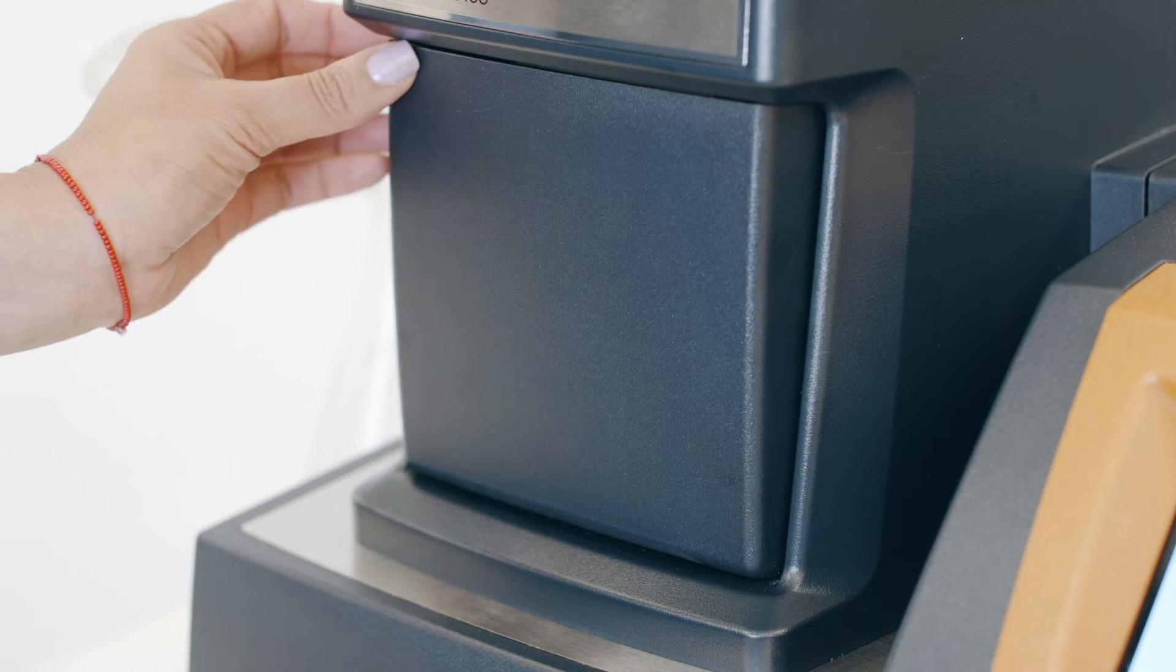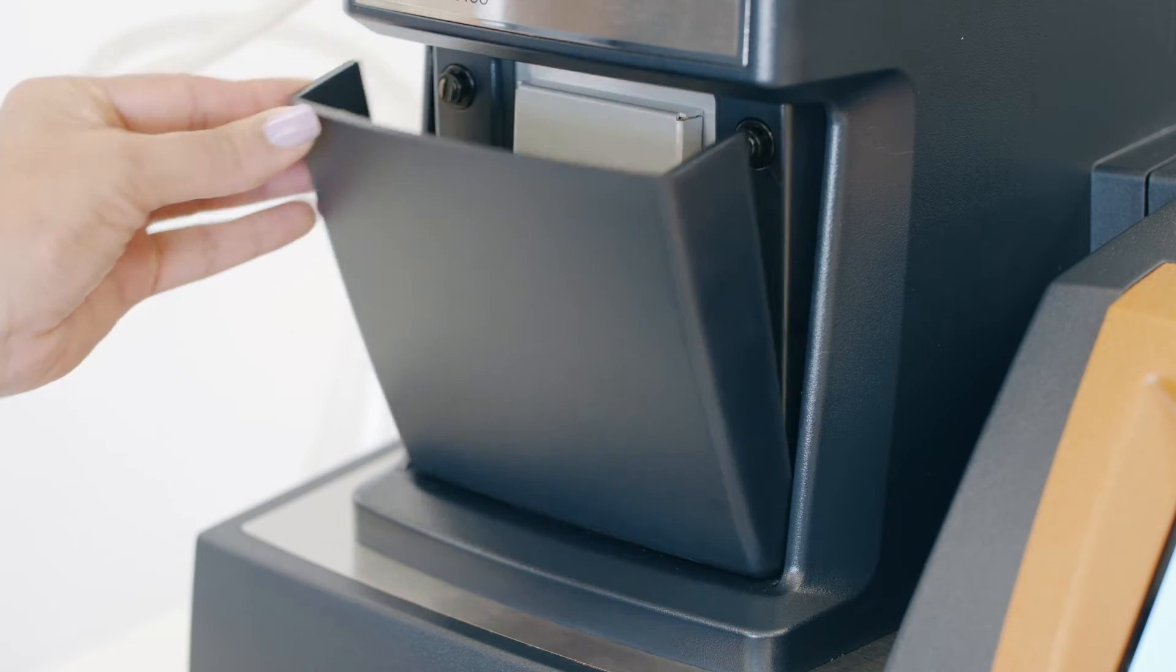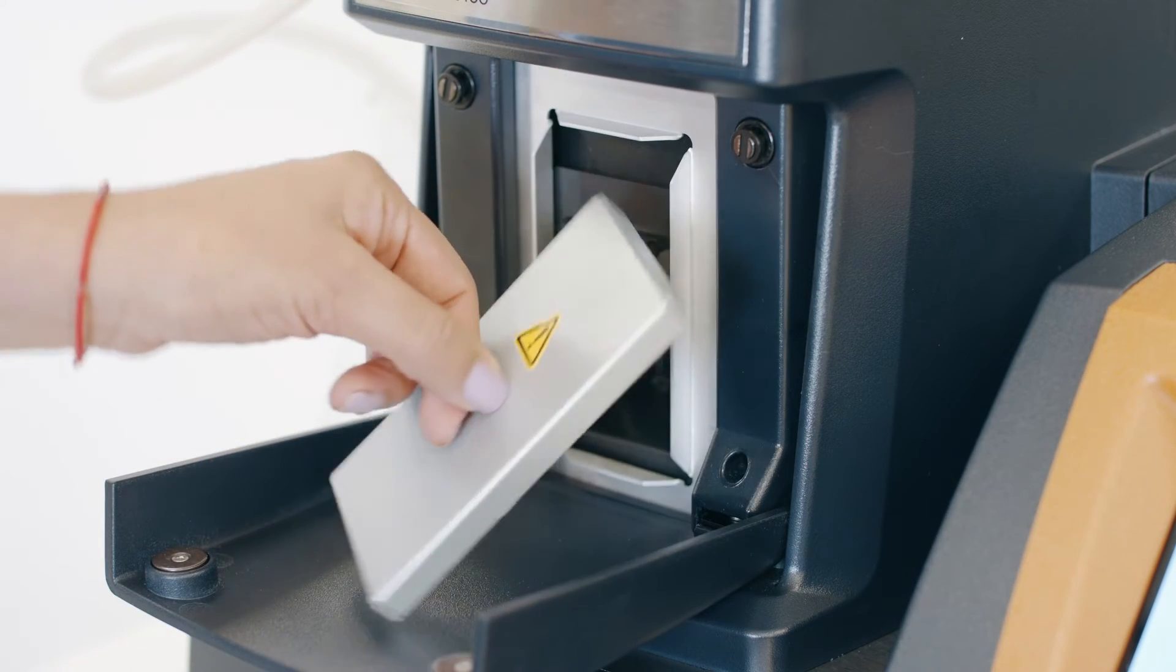To proceed with the force calibration, first make sure the weight tray and stage are cleared.